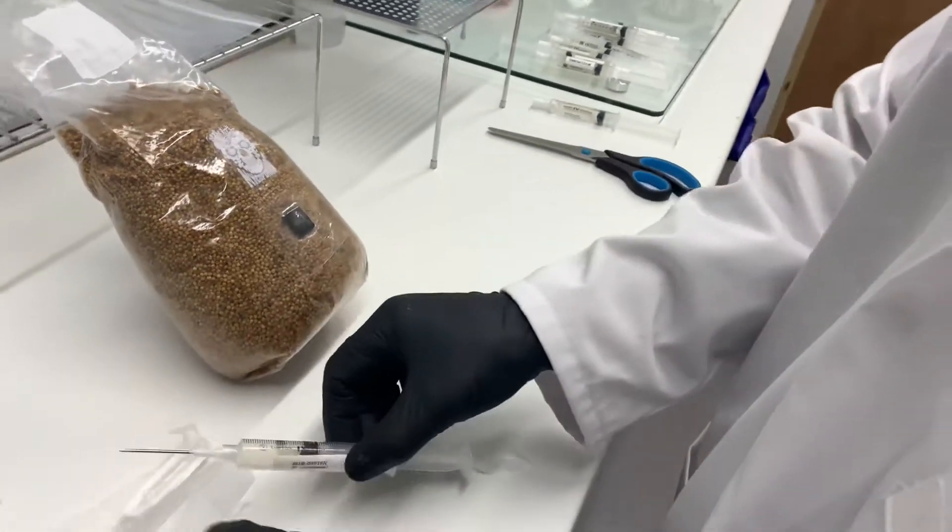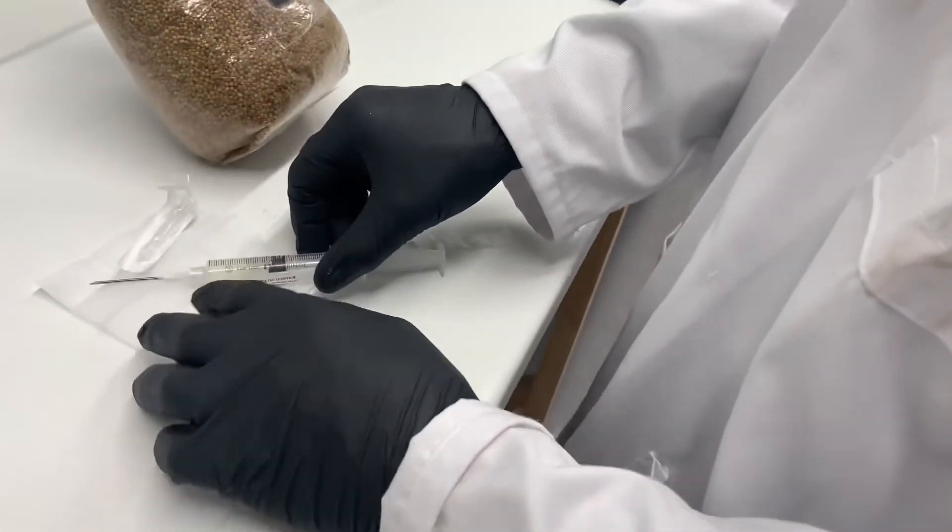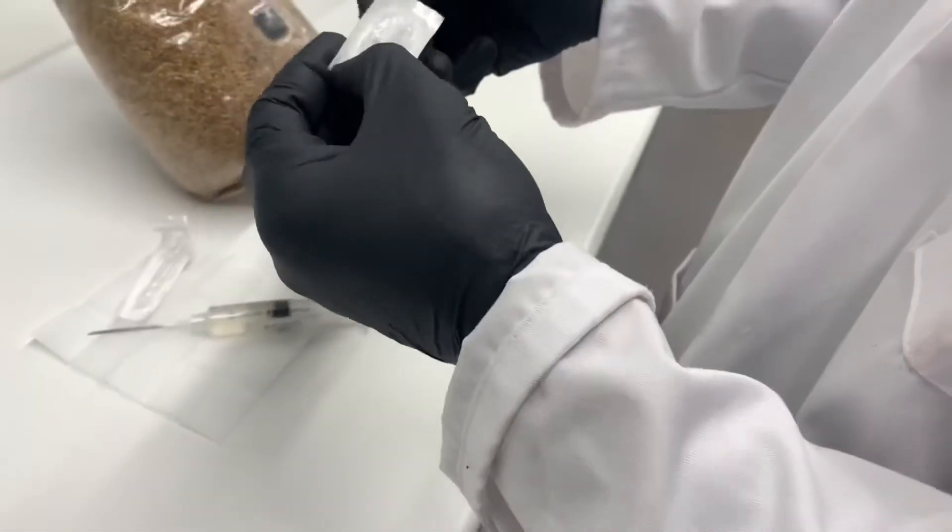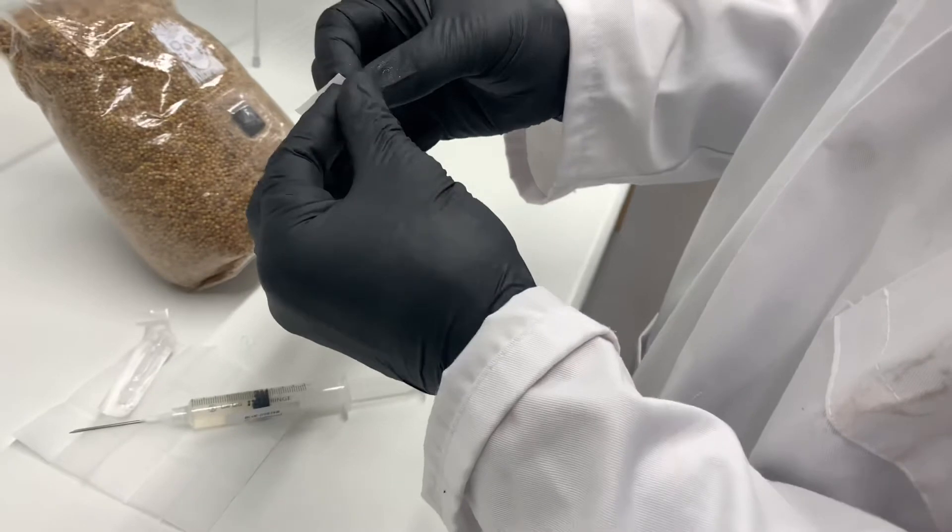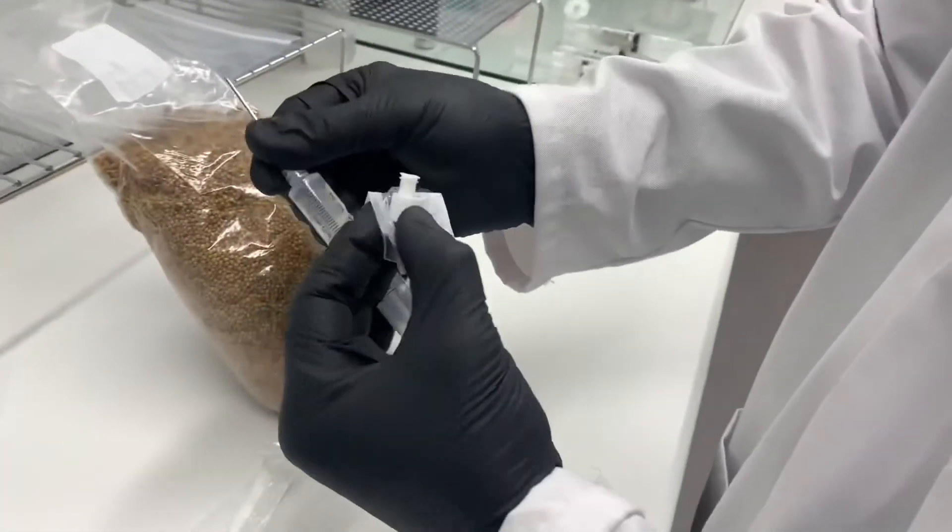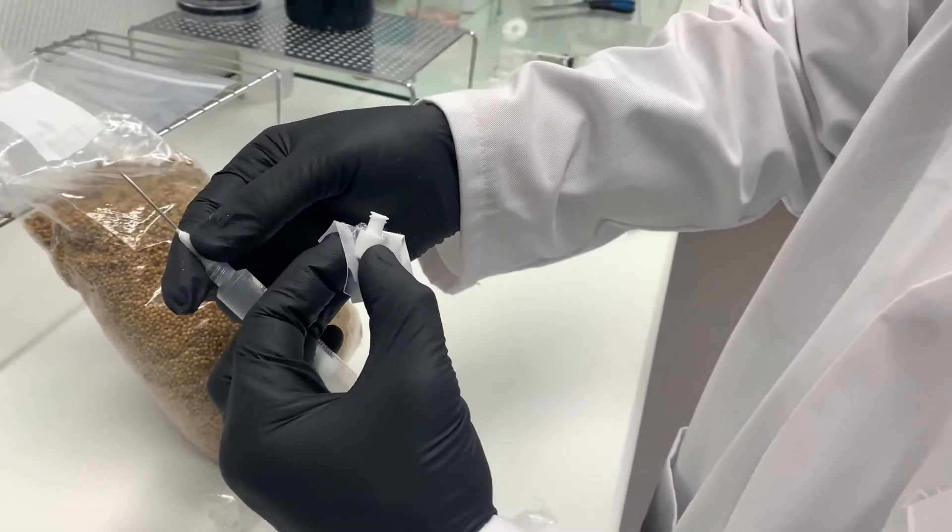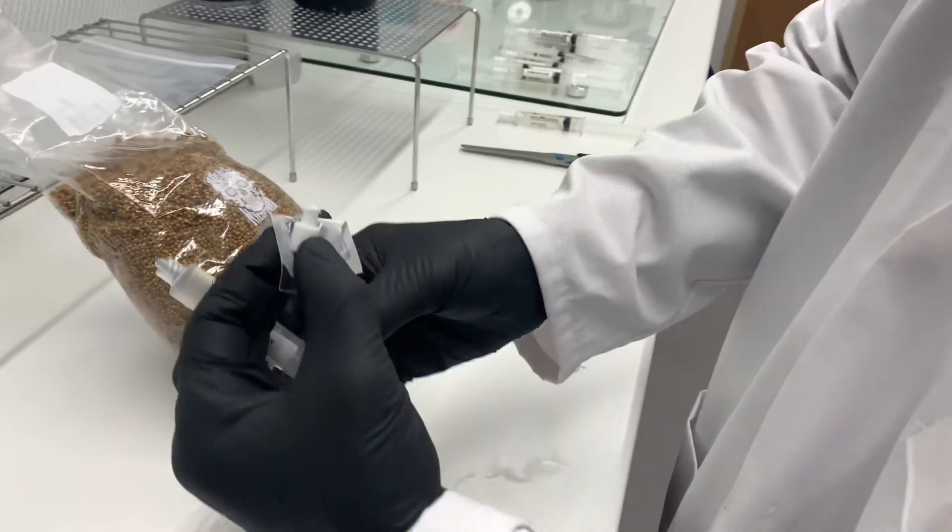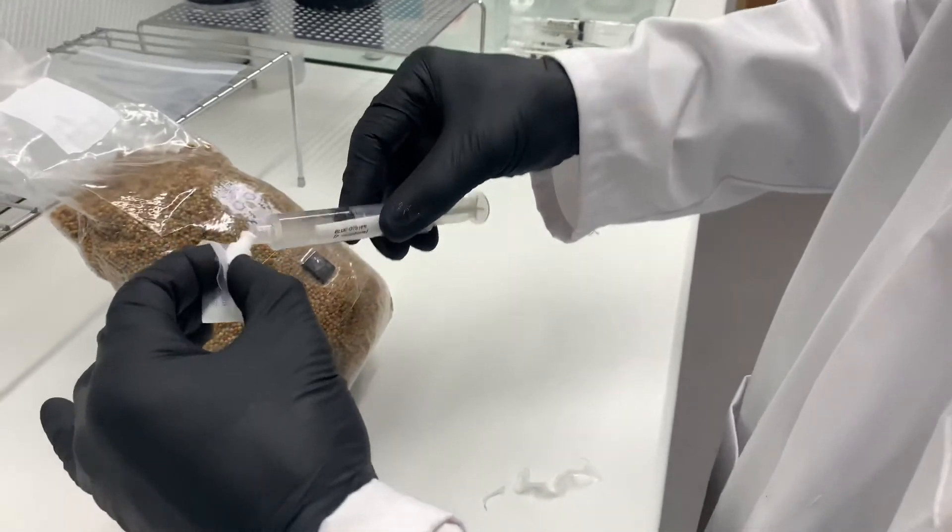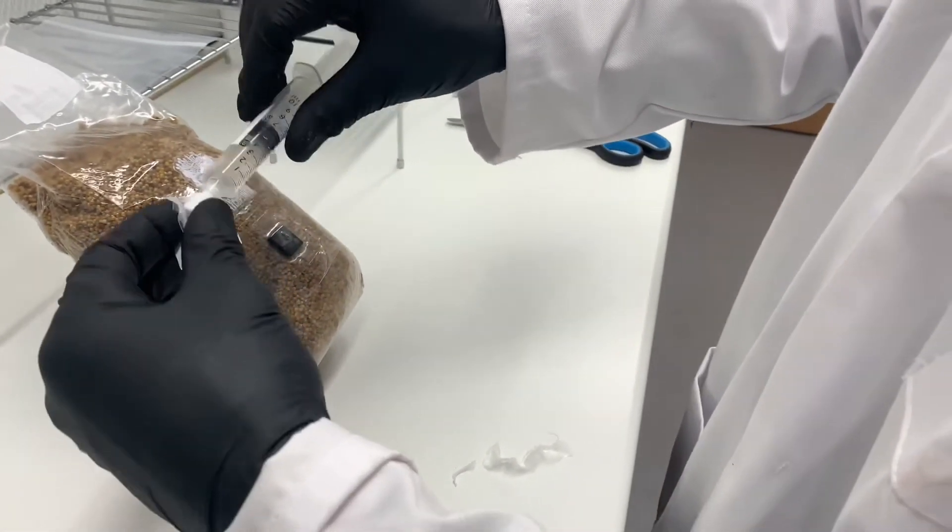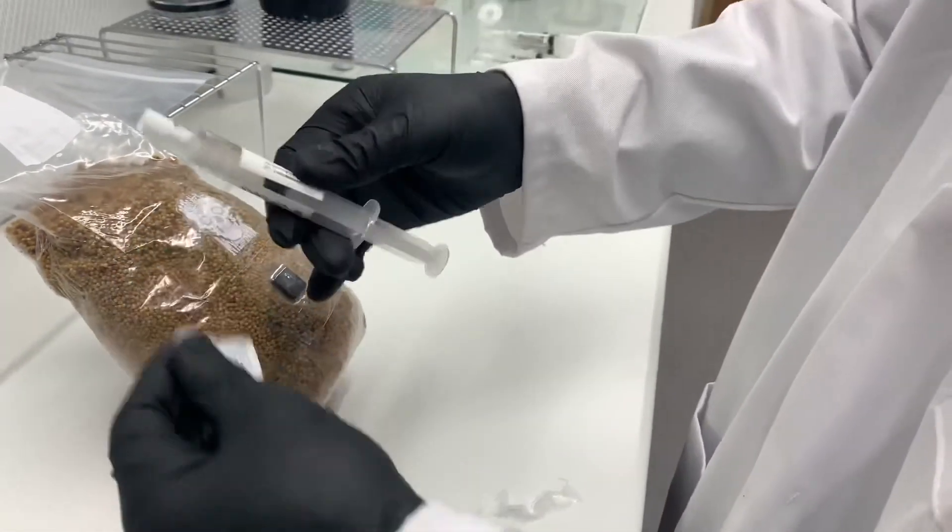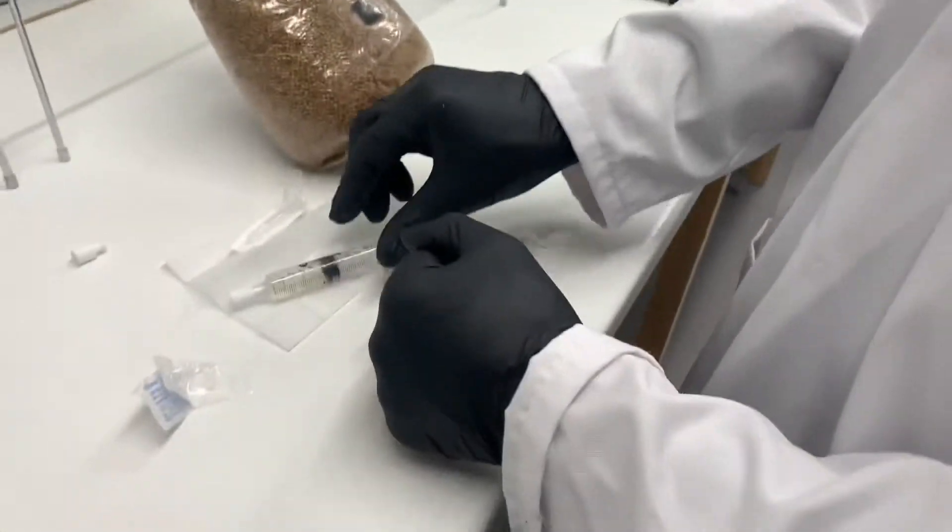Normally we'd put the cap back on here, but we like to live dangerously. So we're going to take out the luer cap instead. There we go, safety first though. Yeah, in future put the cap on, Anthony. And there you go, now that's the luer lock stopper going back in. And now that's good for storage, so you can pop that back in your fridge or whatever. Bag is fully pregnant.